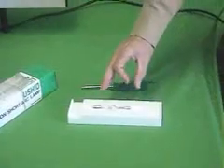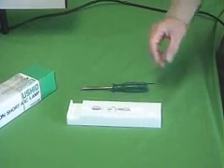Handling the arc lamp you can open it up but leave it in the styrofoam container until you're ready to put it into the housing.